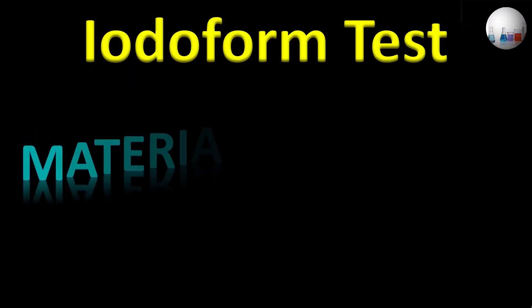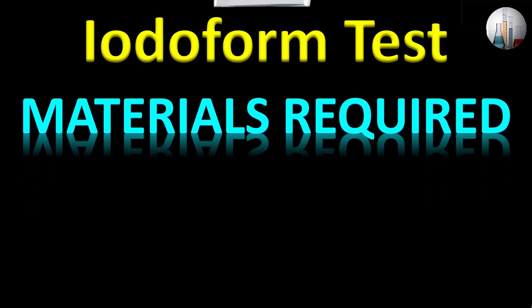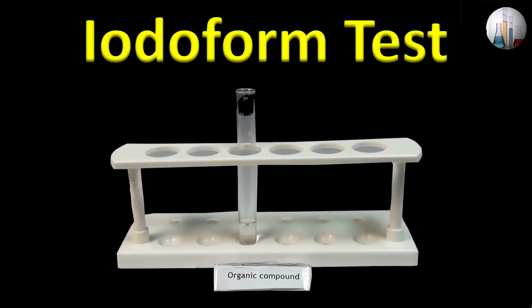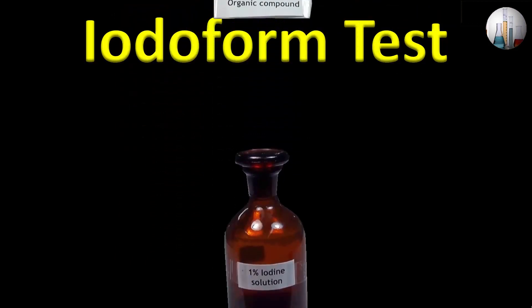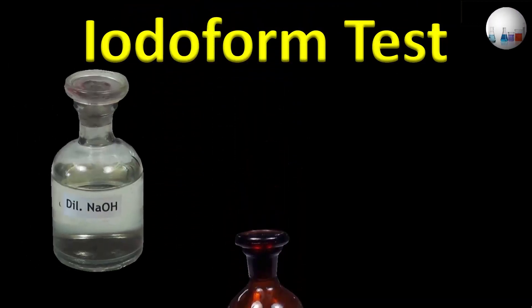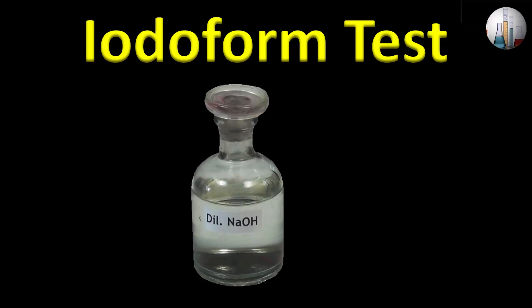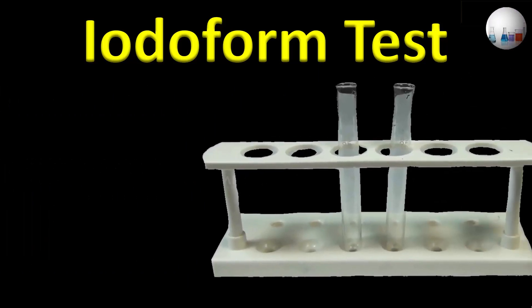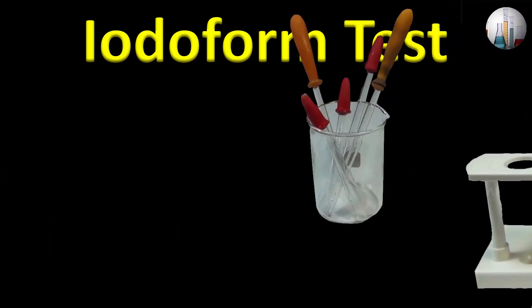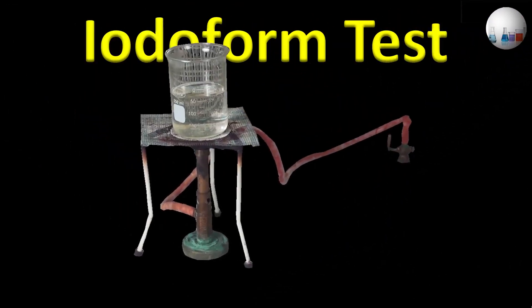The next test is the iodoform test. Materials required: organic compound, 1% iodine solution, dilute sodium hydroxide solution, test tubes, droppers, and water bath.